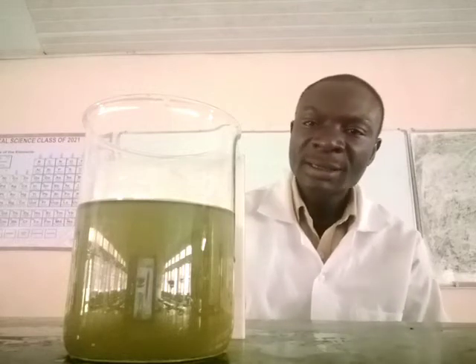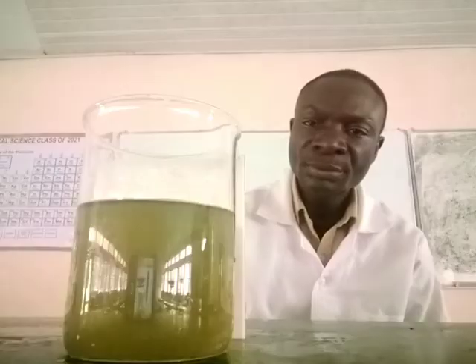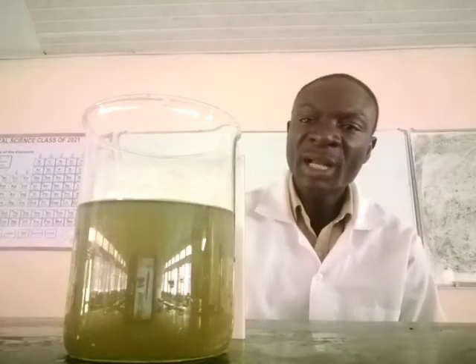Now you can see the yellowish color coming up very clear.